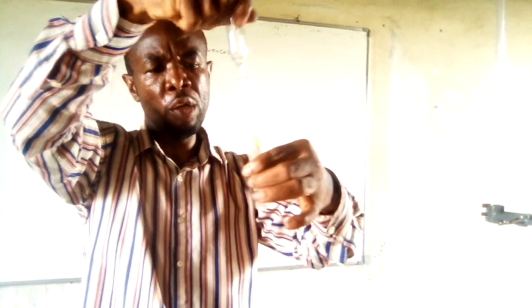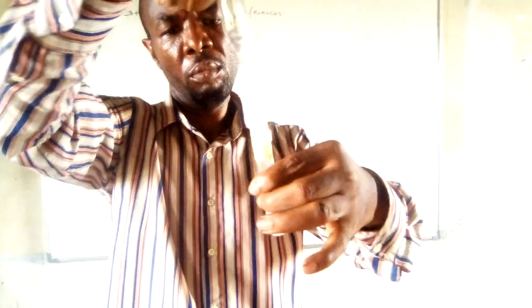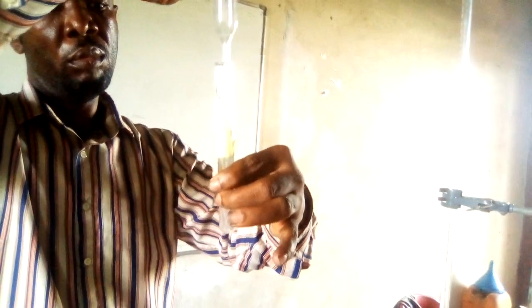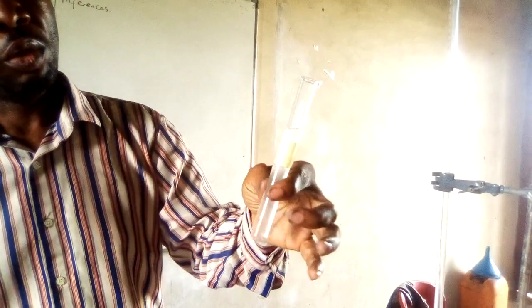You see that C is dissolving gradually. The solution is becoming colorless. Depending on the temperature of the solvent, C can dissolve instantly or may take a while to dissolve. But you see they are not remaining inside again. So C has dissolved completely in water to give a colorless solution.